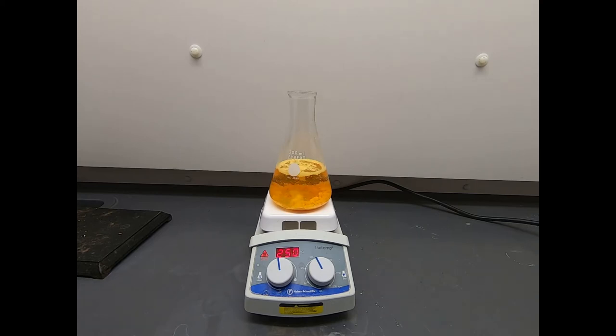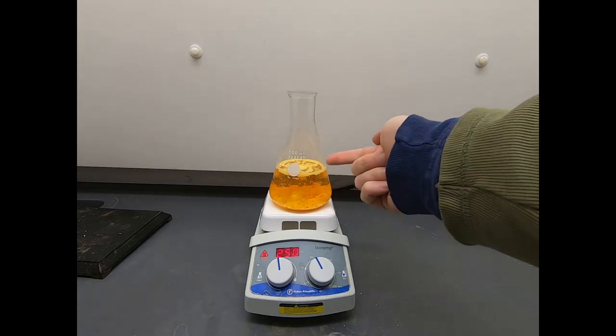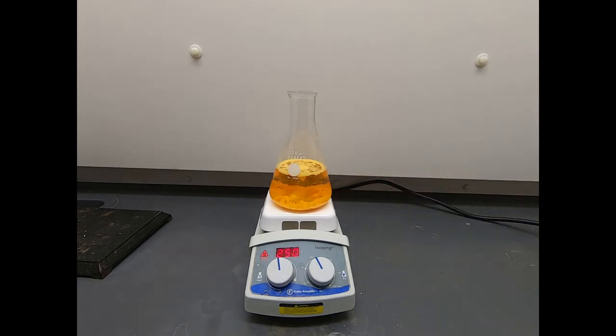Not all substances have a published procedure because not all compounds are bought and then purified. Lots of times you use recrystallization on substances that are unknown, have never been made before. So while I'm showing this procedure for recrystallization, toward the end of the video, we will talk about how you recrystallize unknown substances. And it's going to be a little different from this. But the idea is the same. We want to dissolve our solid in hopefully a minimal amount of a solvent at high temperature, and then as we cool this down, the solubility will decrease and our product will precipitate out and hopefully leave all of those impurities in the solution.